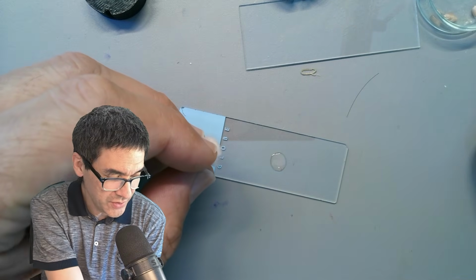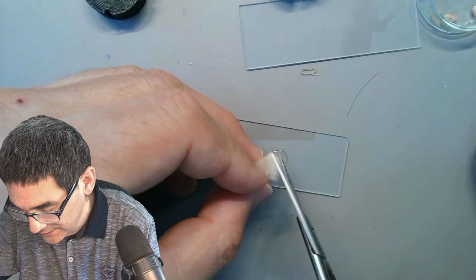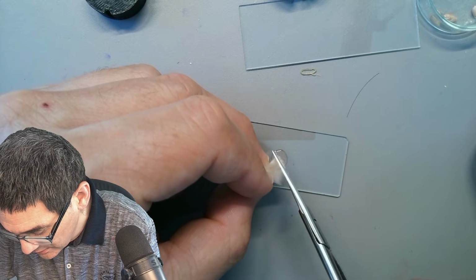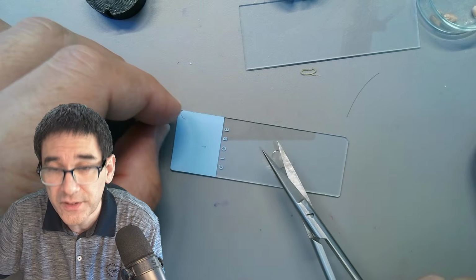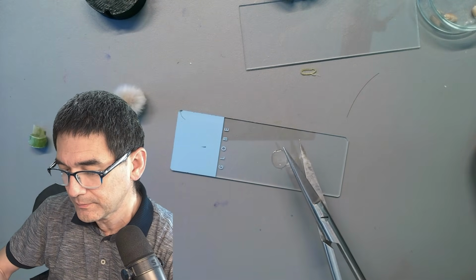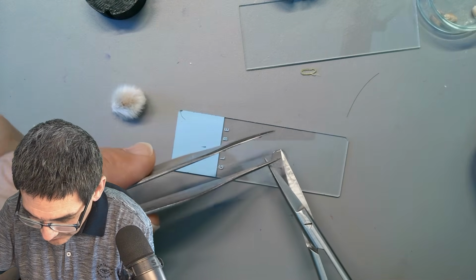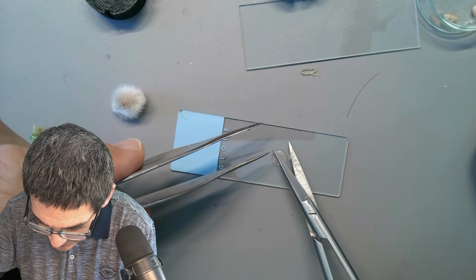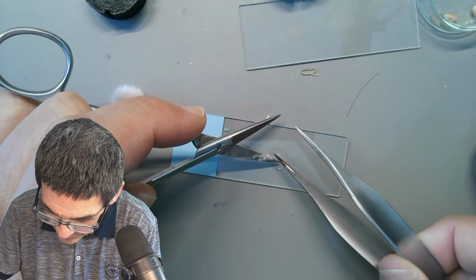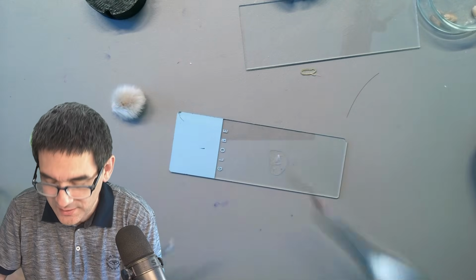I need my scissors, and I'm just going to cut off a little bit of the fuzz. Not so easy. Here's some fuzz on here. I need another tool to get it off. So carefully scratch it off here, and it goes into the water. I know why it doesn't want to go off, because the scissors are not very clean and kind of sticky. So it doesn't matter.